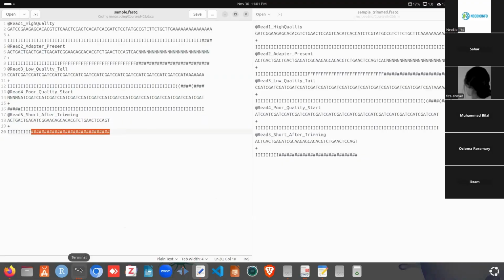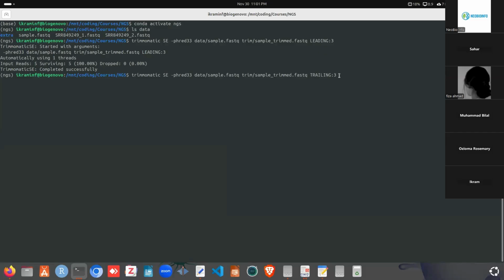So let's try the TRAILING command. This is the score, the threshold 3 we are using. We can use the threshold as much as we need.